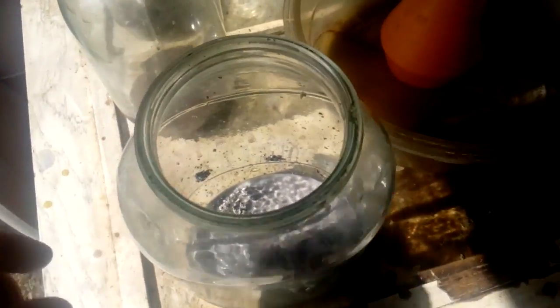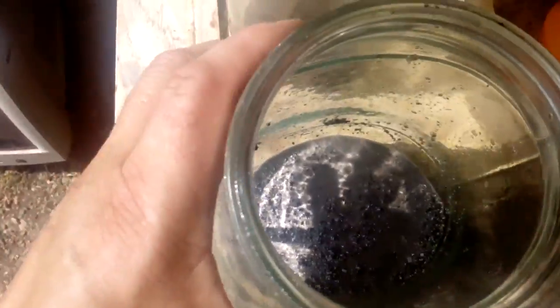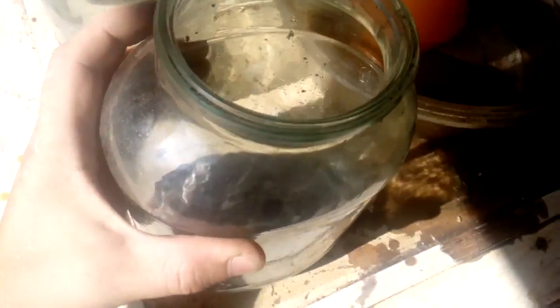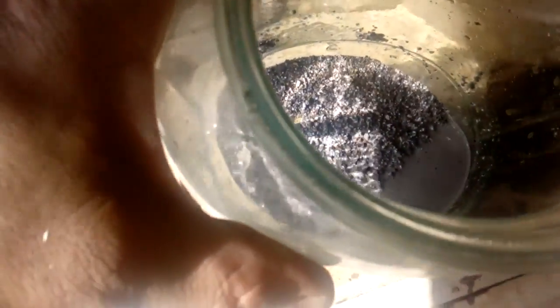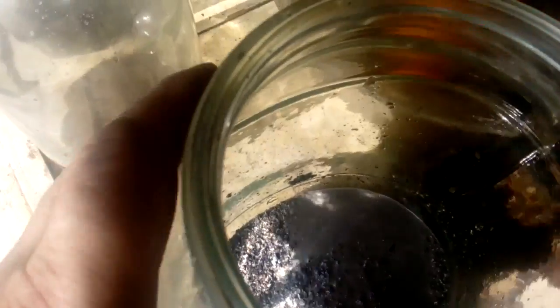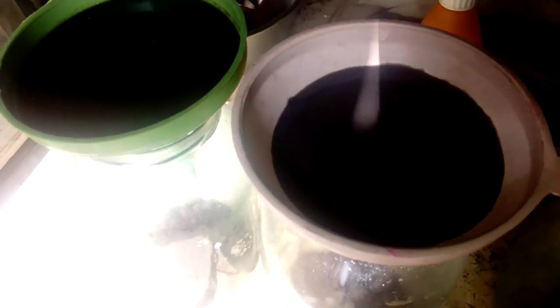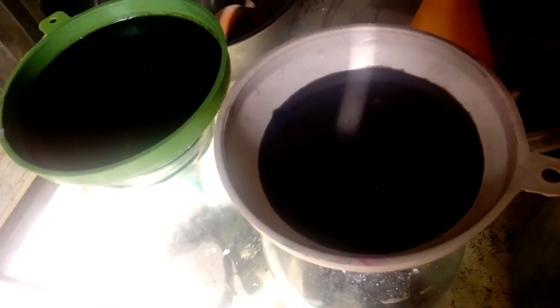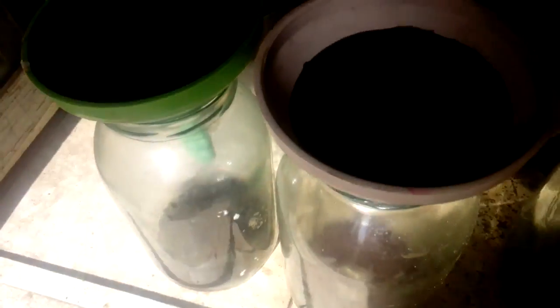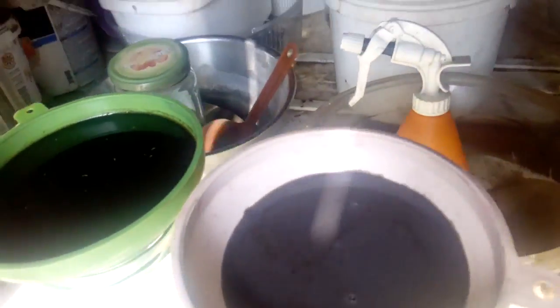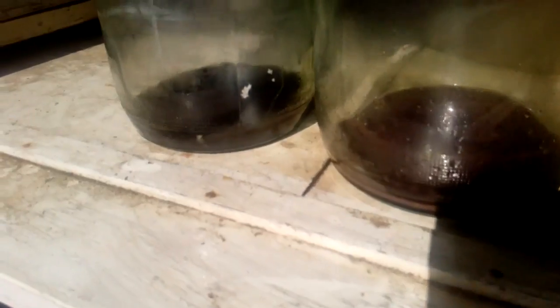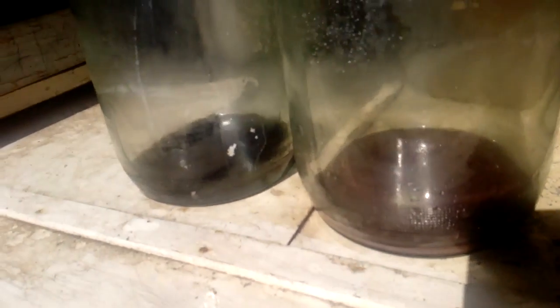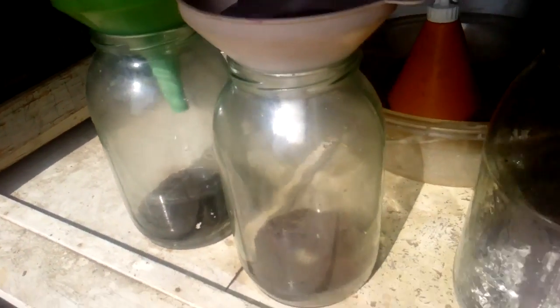Okay, it's past over two days and I decanted the first HCL solution. So you see off the left, it's white slag. And you see that MLCC's, this white stuff, it's silver chloride. So I filter that HCL solution because I want to keep all that silver chloride in the filter. I use Charmin blank, not filter. And you see that it's black, almost black color solution. This is the indicate it's nickel in the solution.